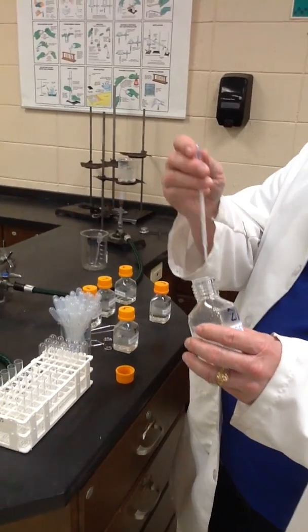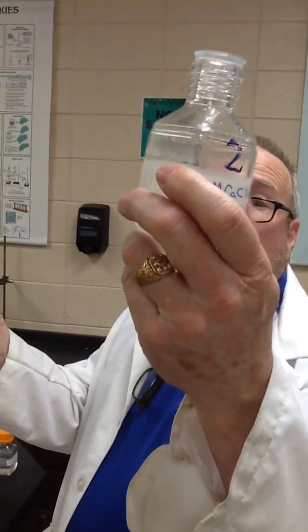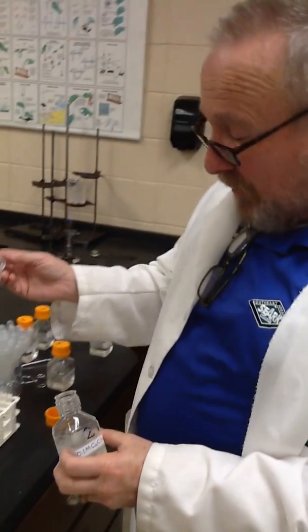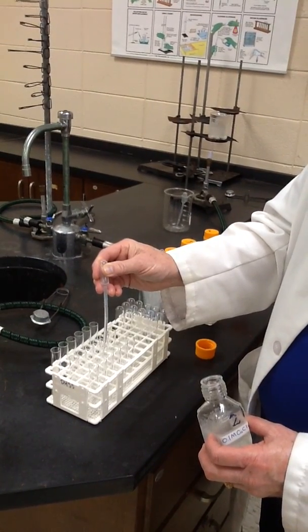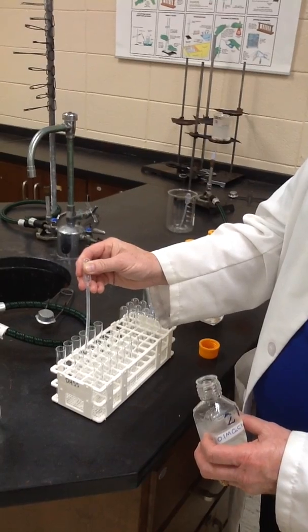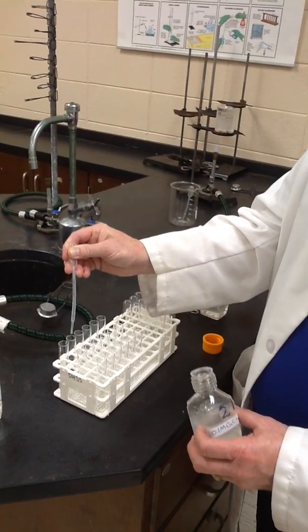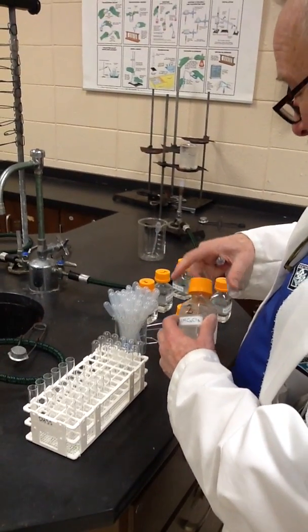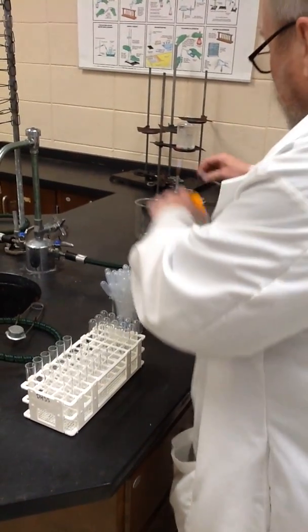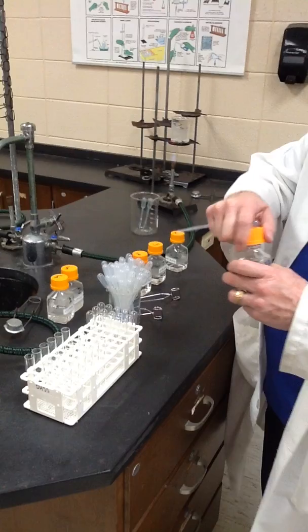So the second one is calcium chloride. If you notice, like many calcium solutions, it tends to form a little precipitate. That's because the calcium ions react with the carbon dioxide in the air to form calcium carbonate, which you may know as chalk, or limestone or marble. And as you know, it's not very soluble, at least in neutral solution. But it will not affect our results. So, that's number 2. Remember, you may notice I'm taking a fresh transfer pipette every time.